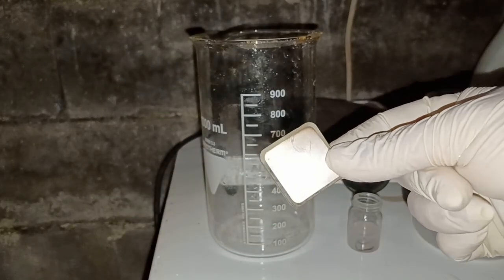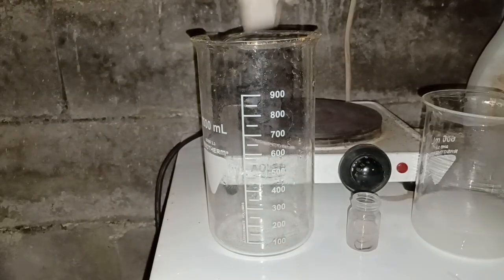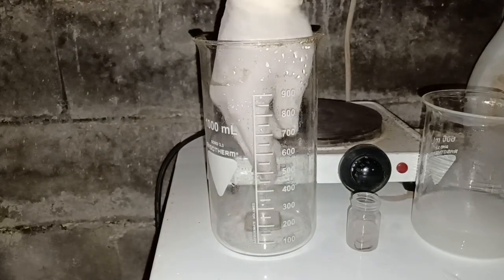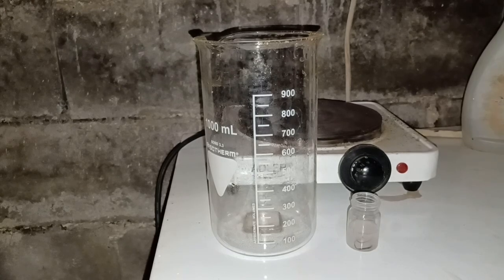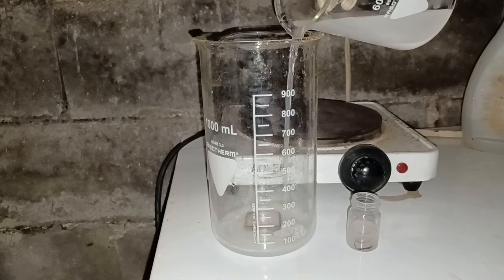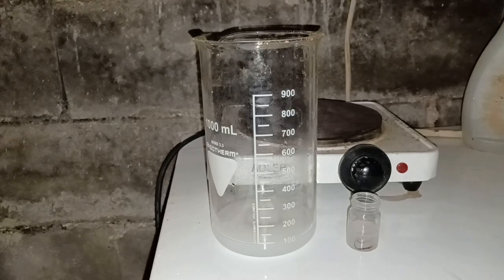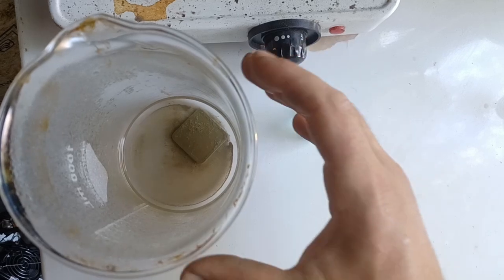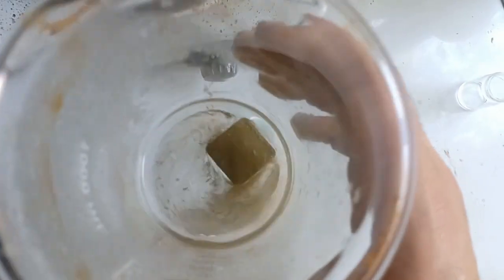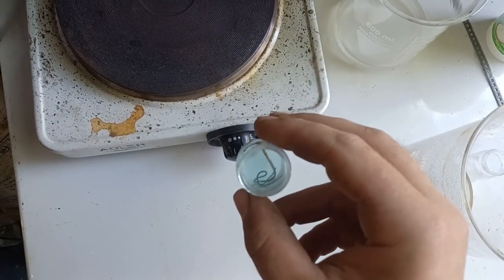To prove it, I dissolved silver out of this big ceramic component. I simply placed it into a beaker, poured on some of the solution, and left it over the night. Next morning I had a clear indication my process worked. Nitric acid removed the silver from the ceramic and dissolved a bit of copper, turning the solution blue.